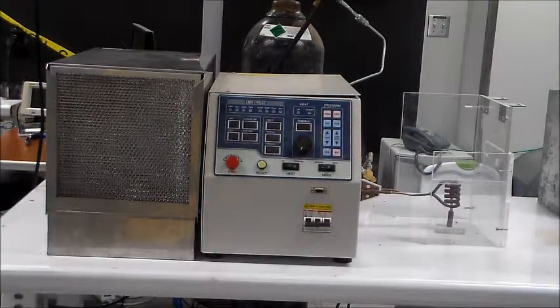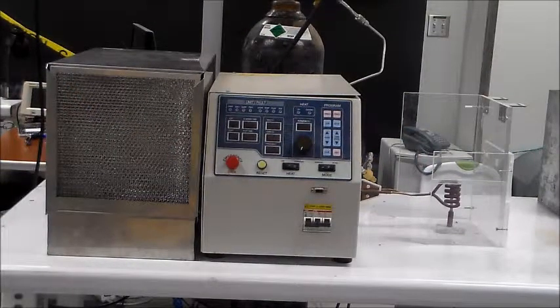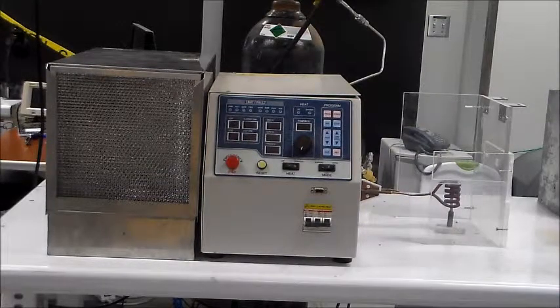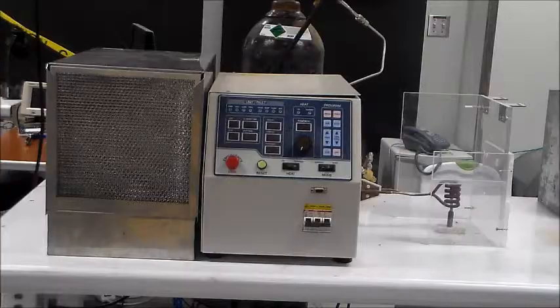Please make sure that you're wearing all your personal protective equipment which includes your safety glasses, your lab coat, and high temperature resistant gloves.